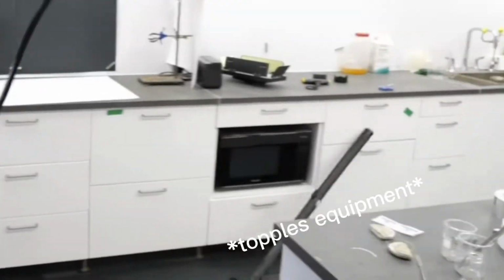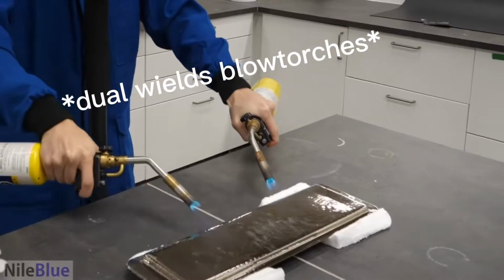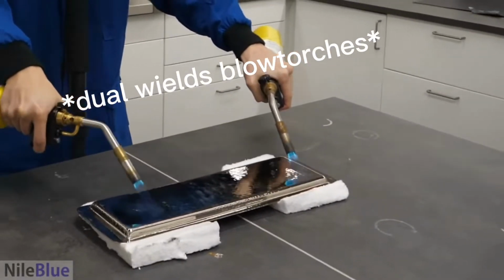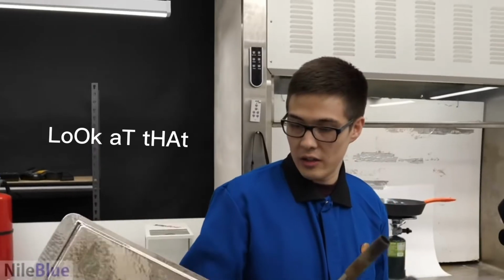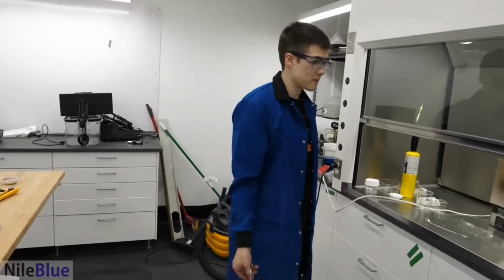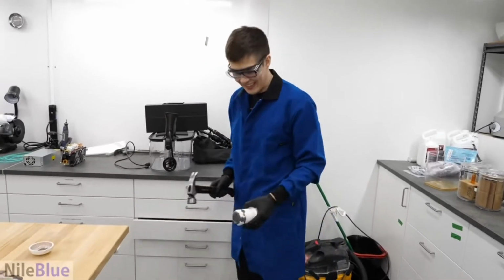Start the high speed. Look at that. My gloves are smoking. Celebrate. This is a pretty good fix right here.